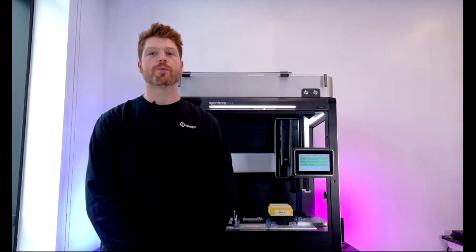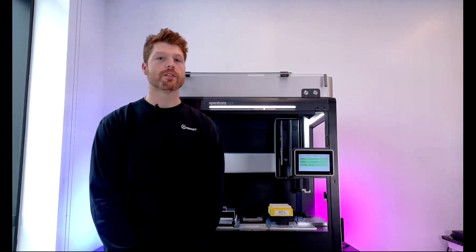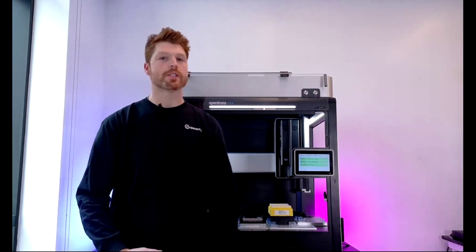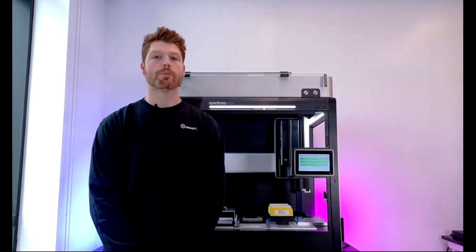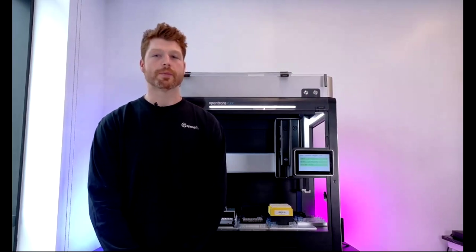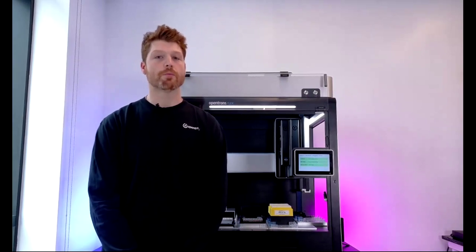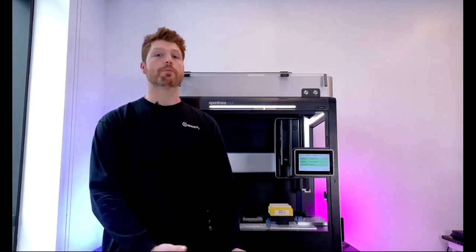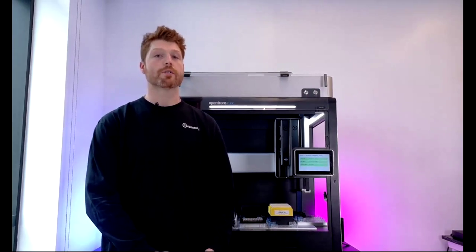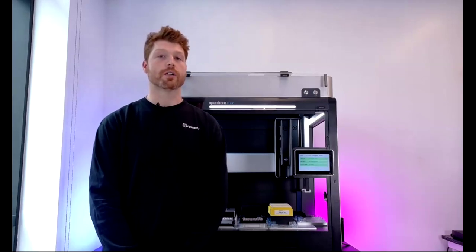First, I want to give an overview of the different ways that you can create protocols for your workflows on the Flex. As Fran mentioned, an FAS from Opentrons team can actually provide on-site application development and optimization. It's great to have them working there with you. We do also offer remote protocol development and optimization. And you do also have the option to write protocols yourself, either through our Python API or through one of our UI-driven tools, such as Protocol Designer.